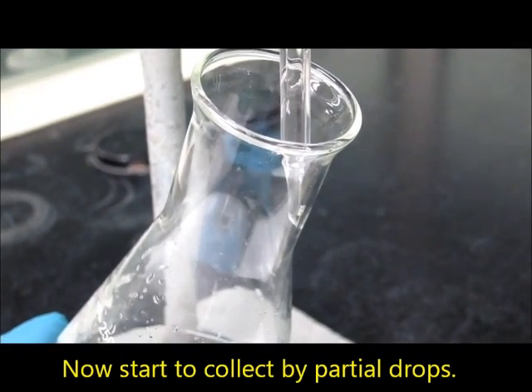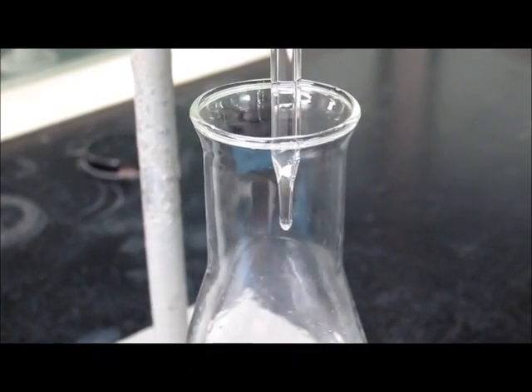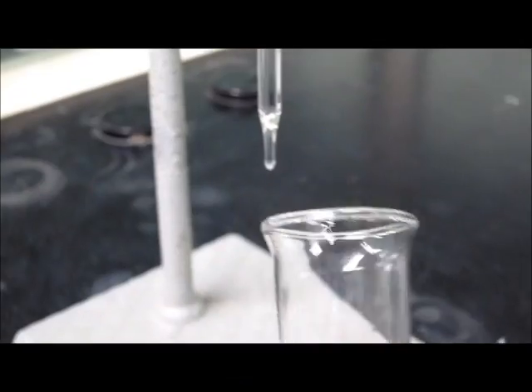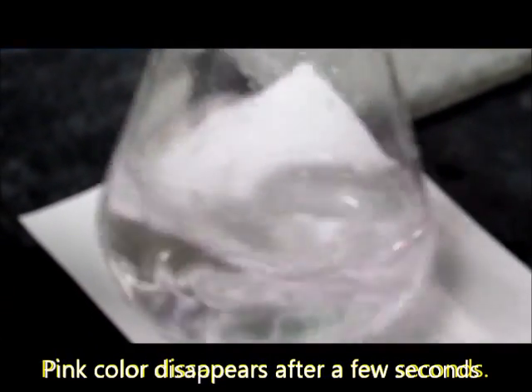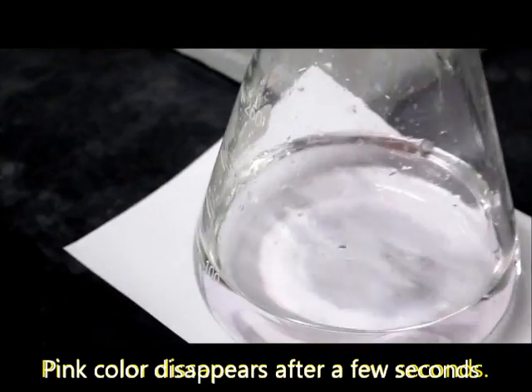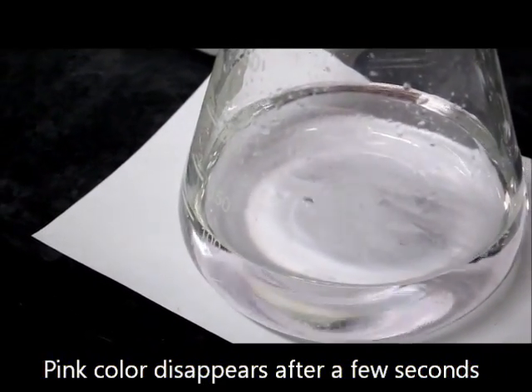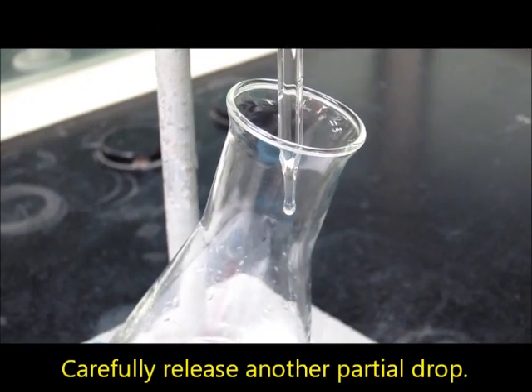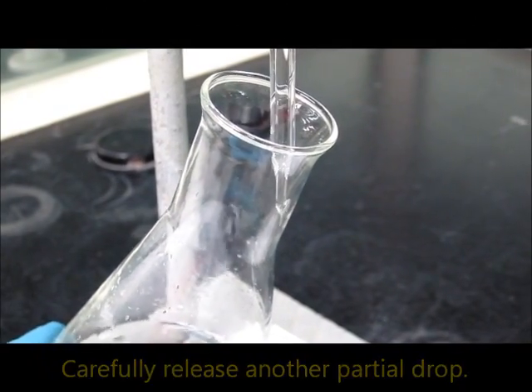Now, we begin to collect partial drops, bit by bit. The pink colour will disappear after a few seconds. Now, carefully release another partial drop.